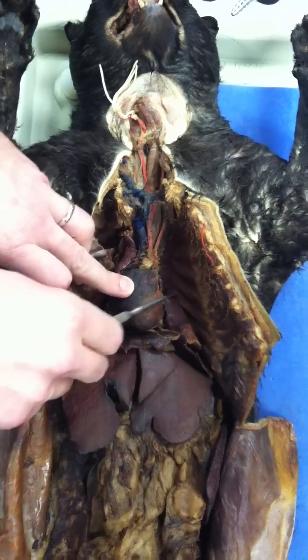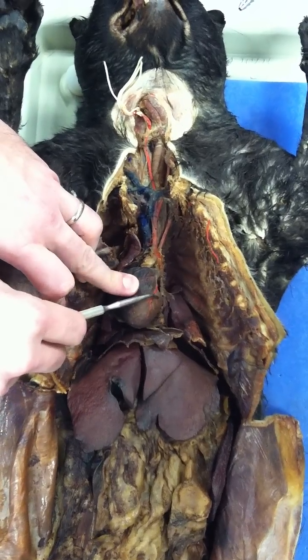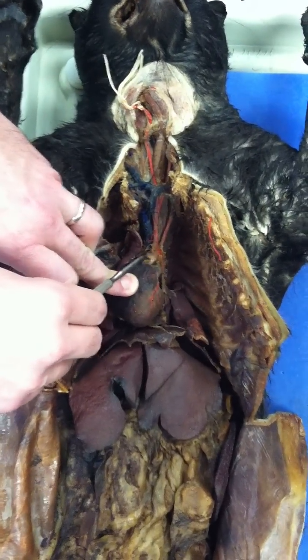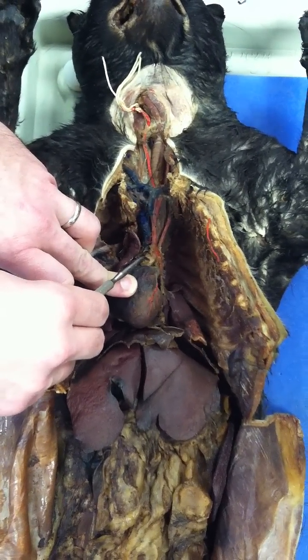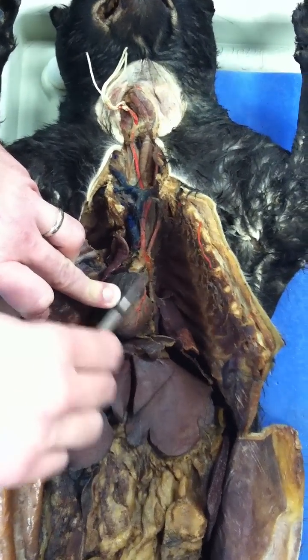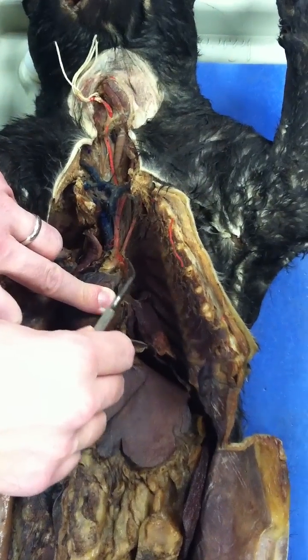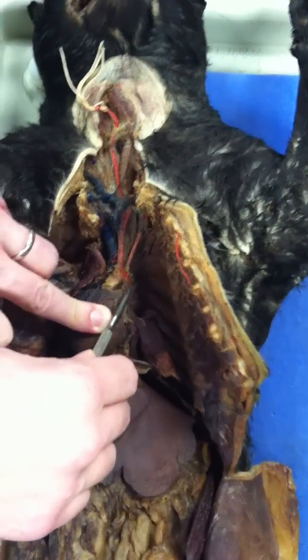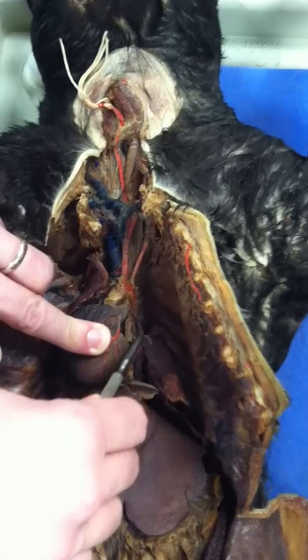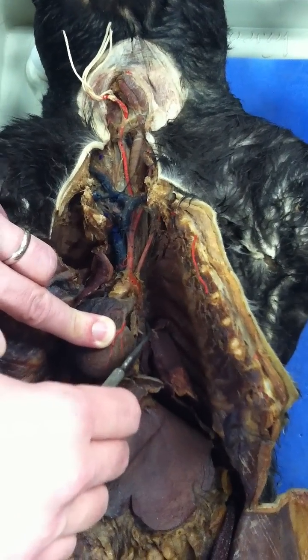We take a look at the arteries and veins of the cat. The heart is always a nice logical place to start. Coming off the top of the heart, this very whitish looking structure is actually the ascending aorta, and you can see it rapidly bends to form the aortic arch and finally the descending aorta, which you can see coming back behind the heart here.